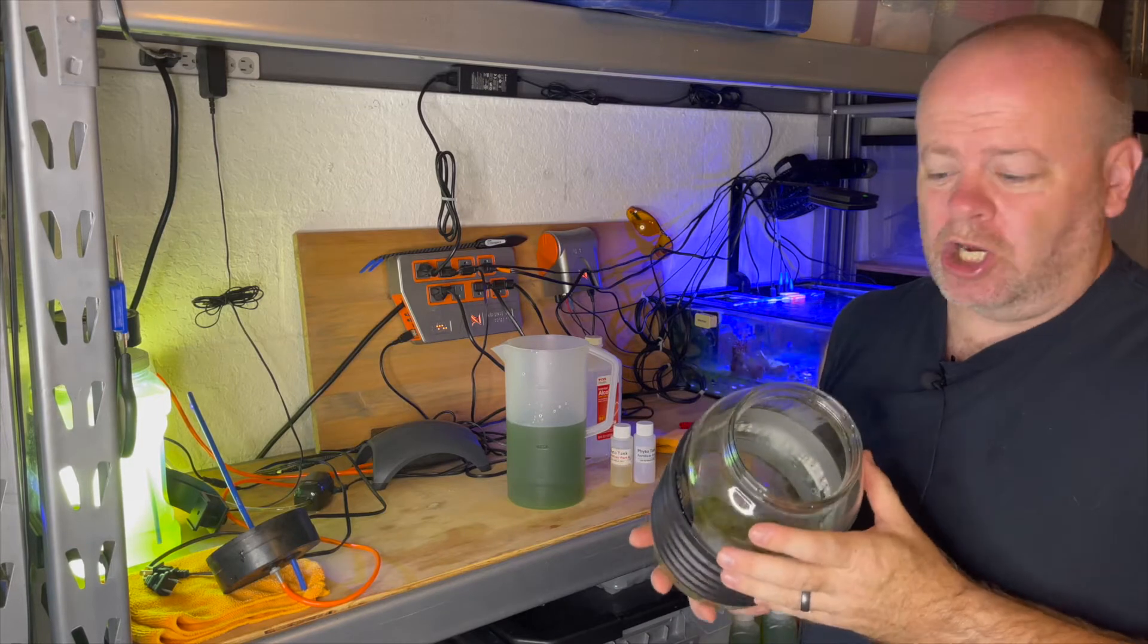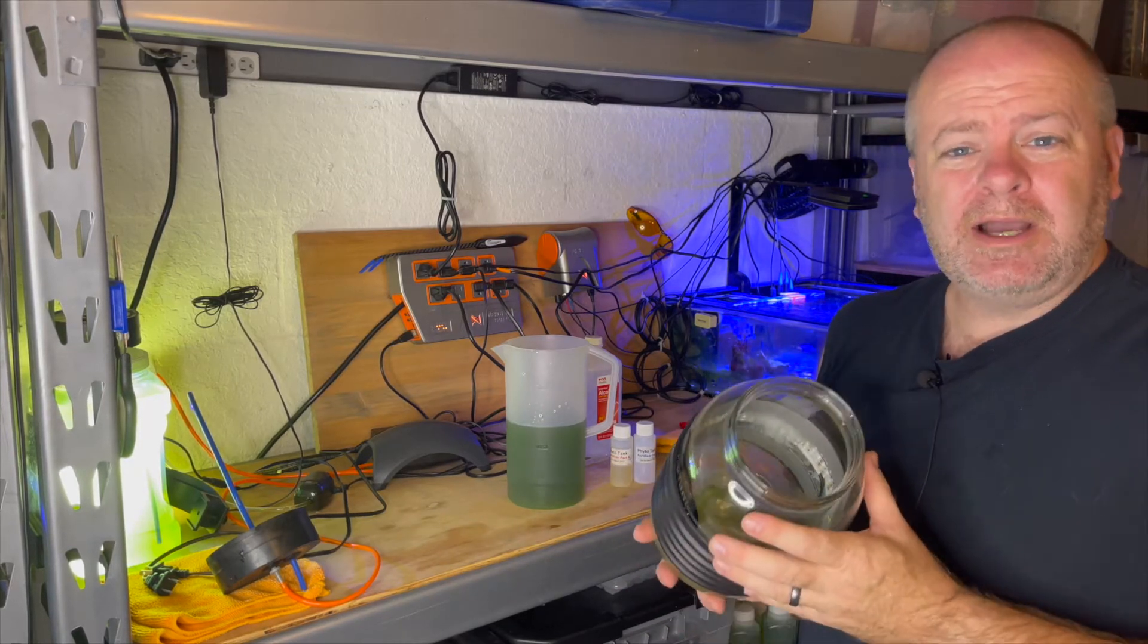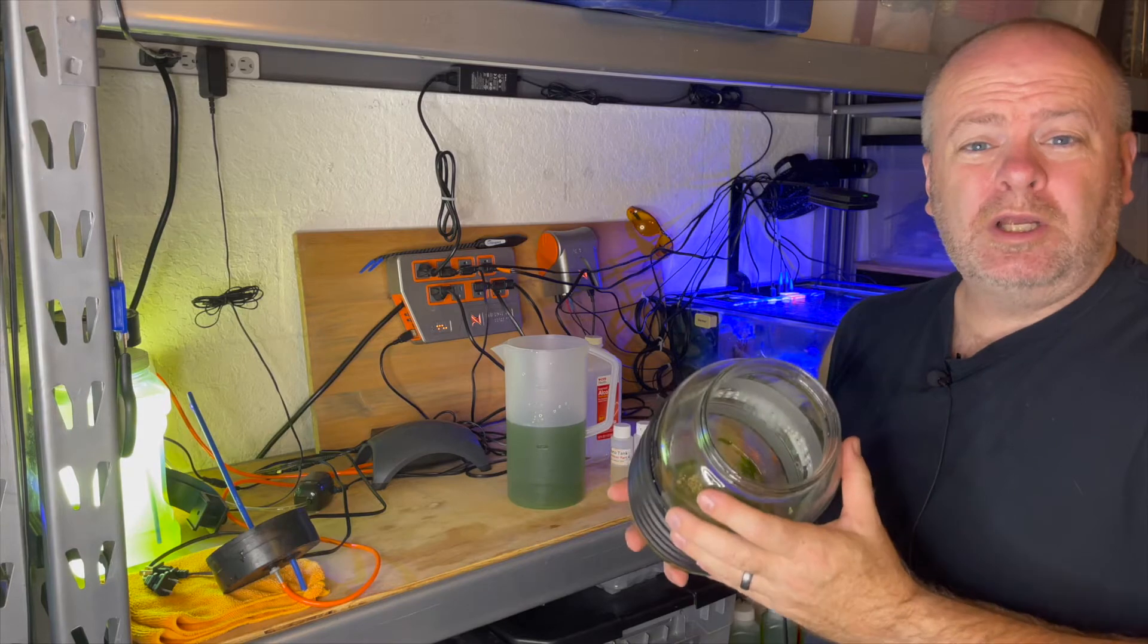Typically, I would not put this in a jar. I don't know what that would do, if anything, but I'm not going to take that risk. So I'm going to wash this and I'll be right back.